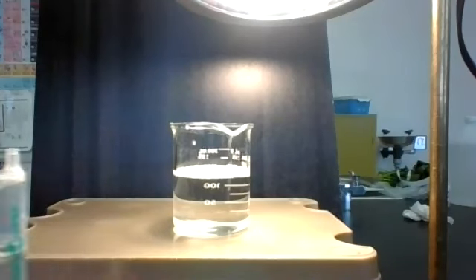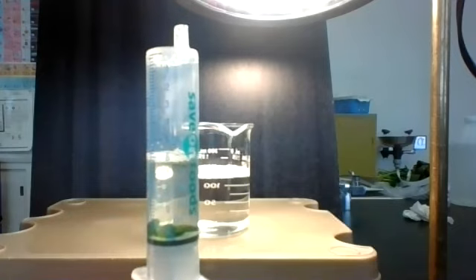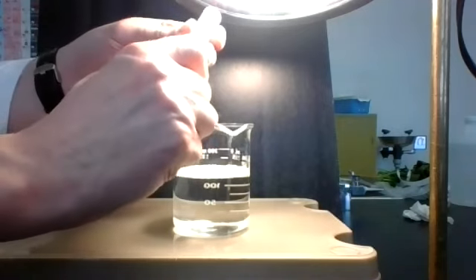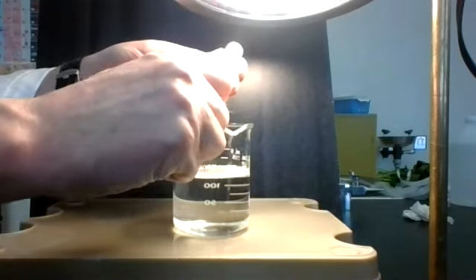Floating Leaves Lab. There are the leaves right at the bottom of the syringe. I'm going to put them in, and as soon as I put them in, start your timer. On your marks, get set, go.